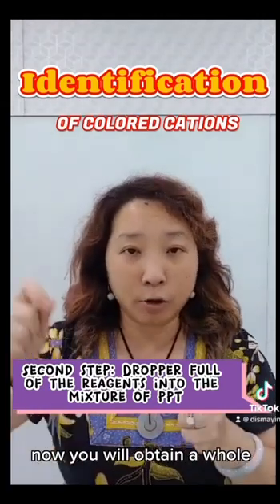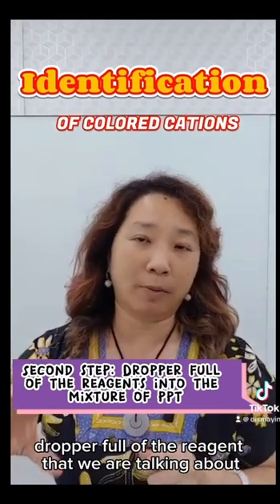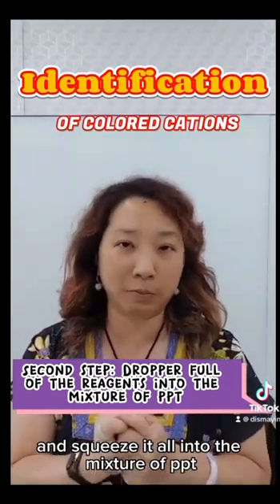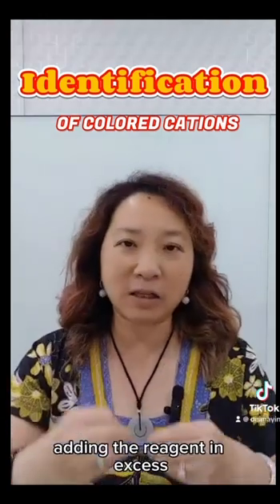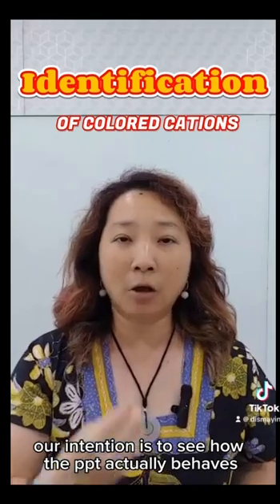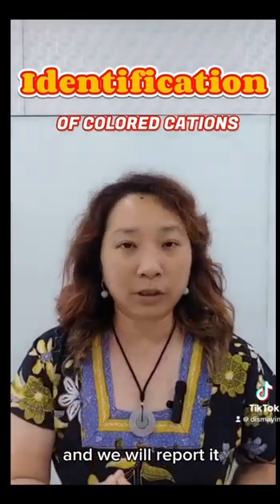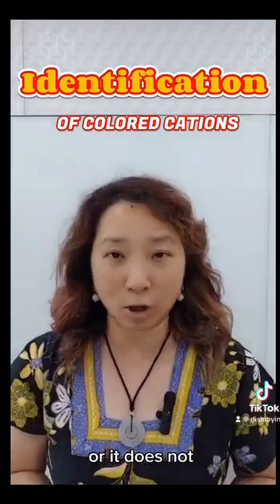What you do is now you will obtain a whole dropper full of the reagent that we are talking about, either sodium hydroxide or aqueous ammonia, whole dropper full, and squeeze it all into the mixture of PPT all at the same time. So this second step is actually what we call adding the reagent in excess. Our intention is to see how the PPT actually behaves in the presence of all that excess reagent, and we will report whether the PPT dissolves in the excess of the reagent or it does not, and hence it just remains there.